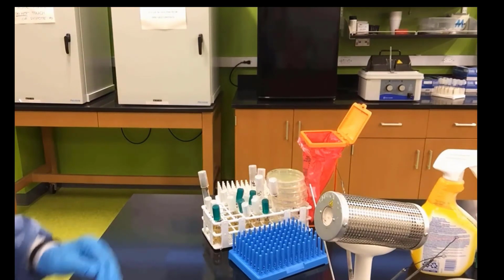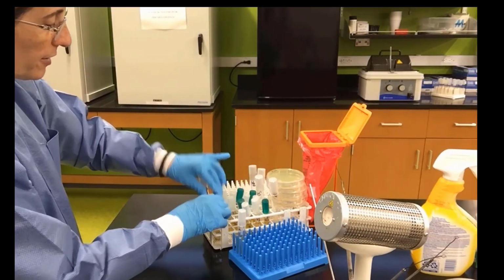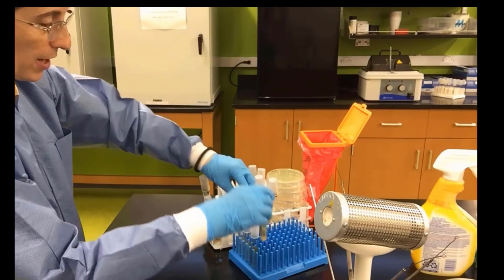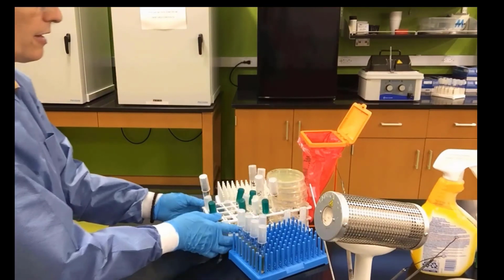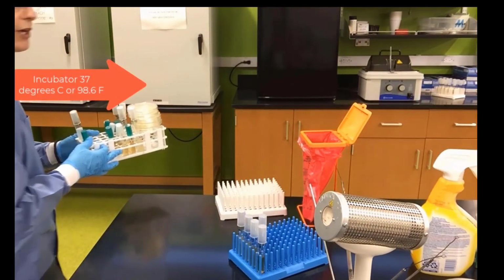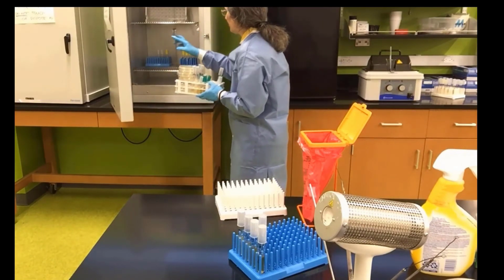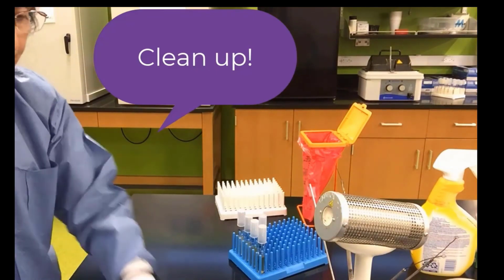There are two more steps that we need to take. We need to first make sure we take out the original stock bacteria, the ones that were given to us. And then place the new bacteria, the new media, into an incubator, 37 degrees Celsius or 98.6 degrees Fahrenheit. Place them in the incubator for 24 to 48 hours and come back and read the results.